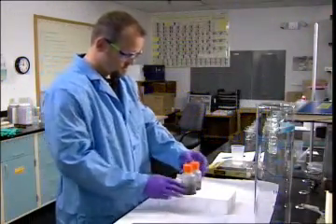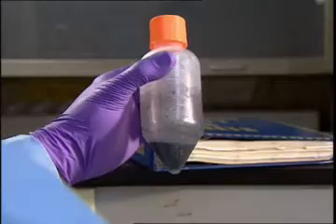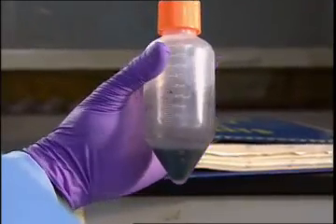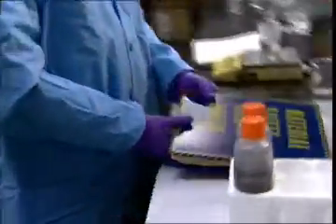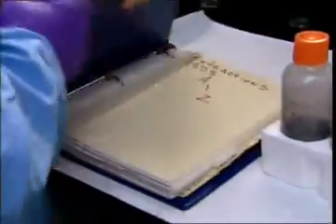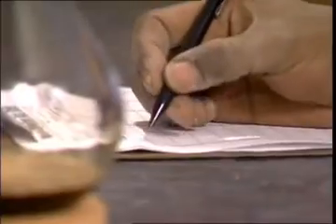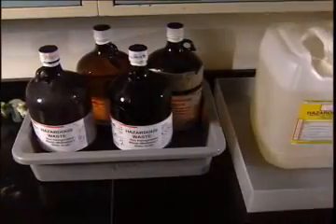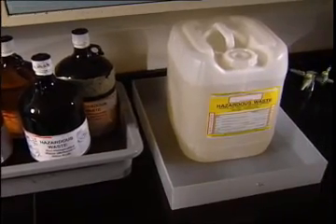The first task in proper management of hazardous laboratory wastes is characterization. That is, determination of what is in the waste and whether it is hazardous. For wastes from standard or routine procedures, this determination may already have been done. However, where the procedures are non-standard or change frequently, such as in a university or research lab, waste profiling may take considerable work. Generally, the scientist who generates the waste is principally responsible for identifying the components present in the waste.